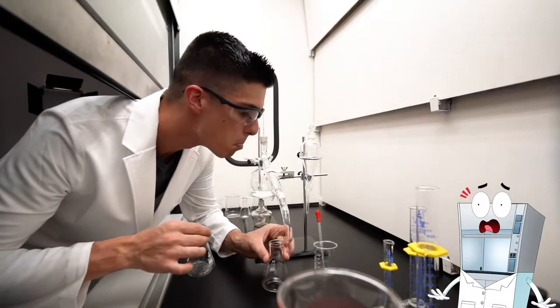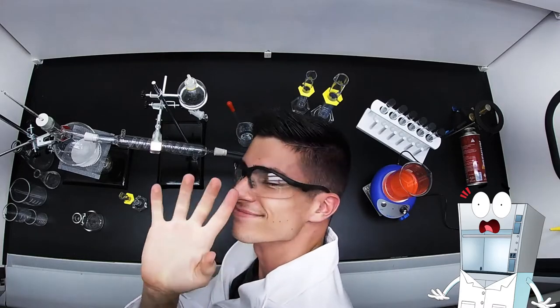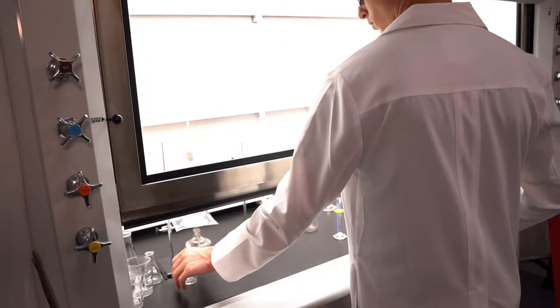Don't ever put your head in the fume chamber. You will be breathing harmful fumes and contaminants. Always reach in through the sash opening.